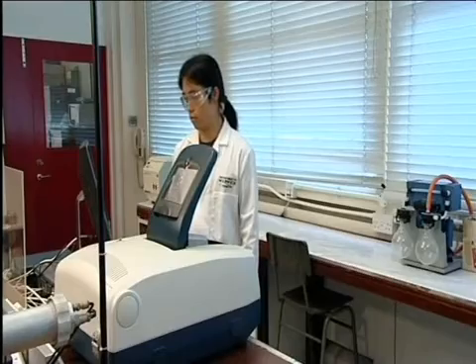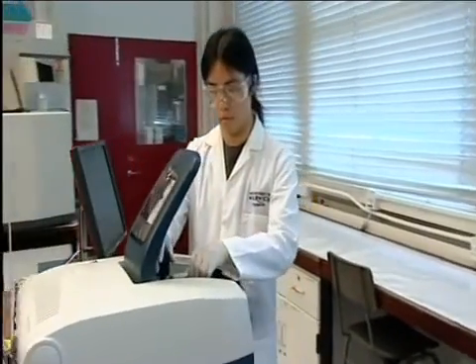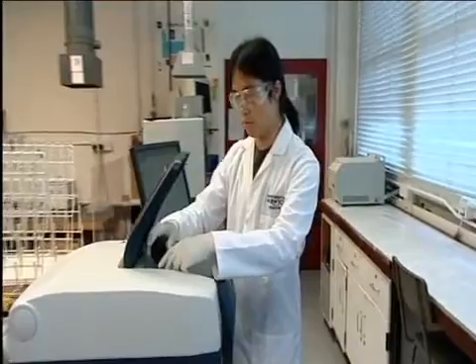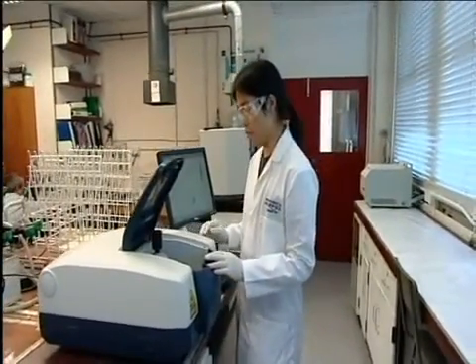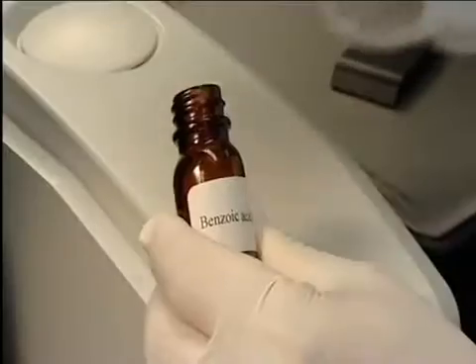Here we will run the IR spectrum of solid benzoic acid. The instrument is switched on and a blank is run with no sample in place. This is to find the absorption of the air which must be subtracted from that of the sample.